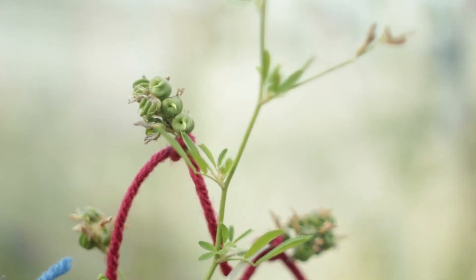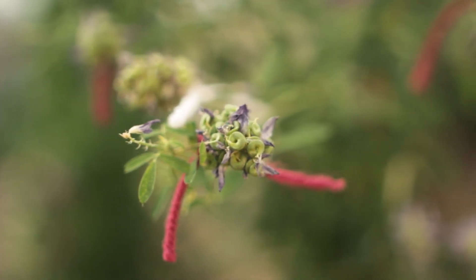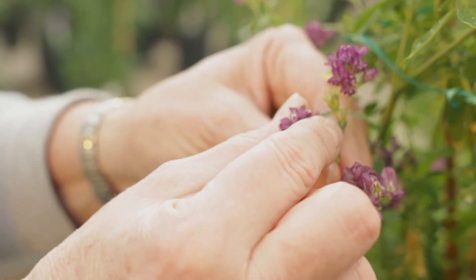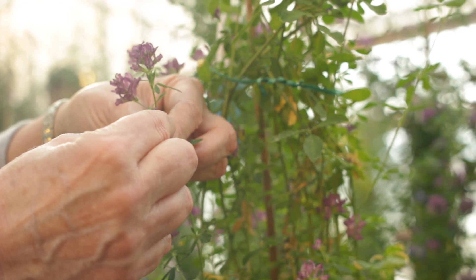In genetic studies, seeds from self-pollinations are often required. Note that with the high level of inbreeding depression in alfalfa, the seed set will be low — one to two seeds per pod — and seedling vigor will be weak. Self-pollination can be done by simply rolling the racemes between the thumb and forefinger to trip flowers.